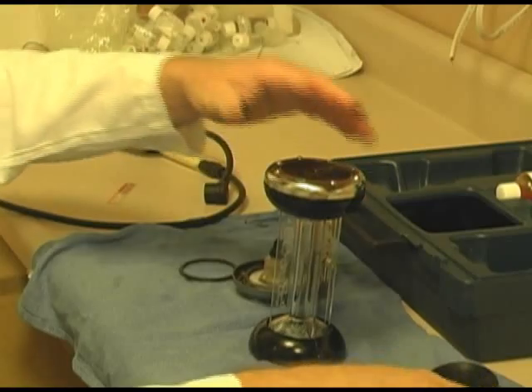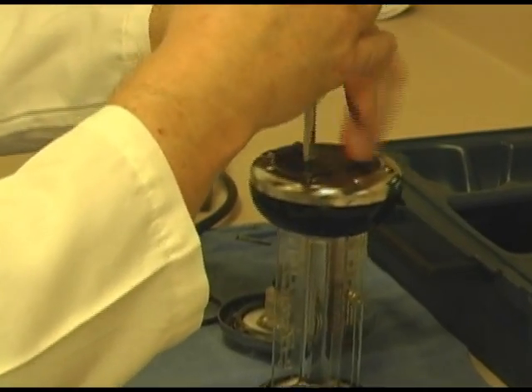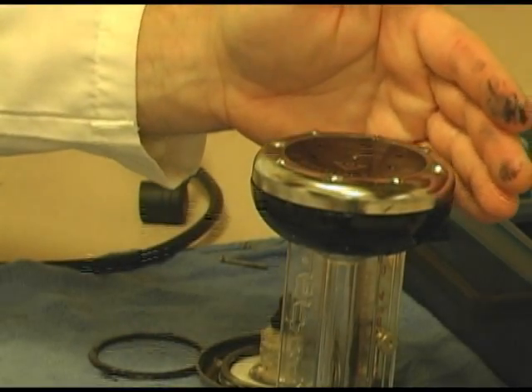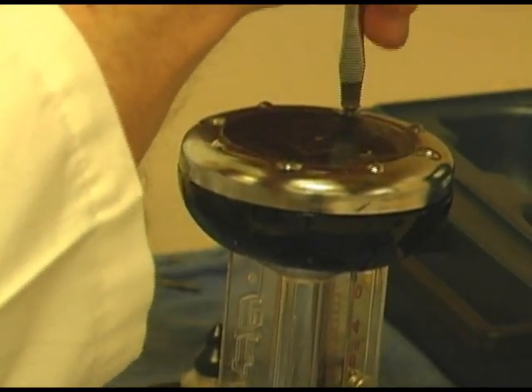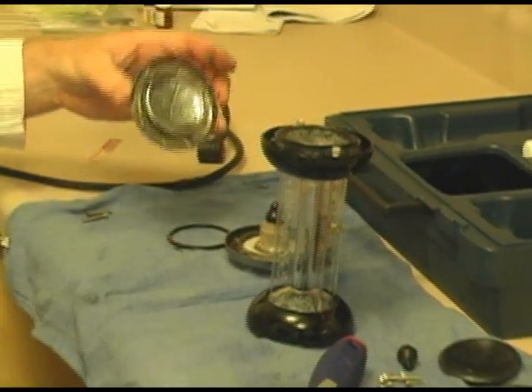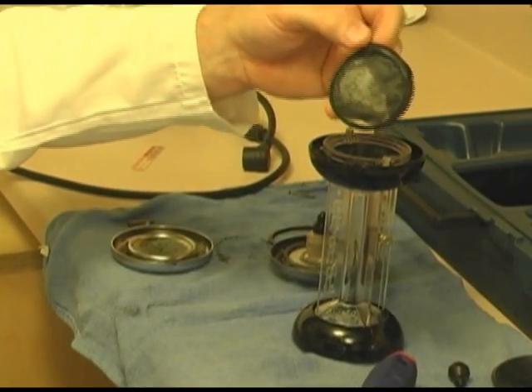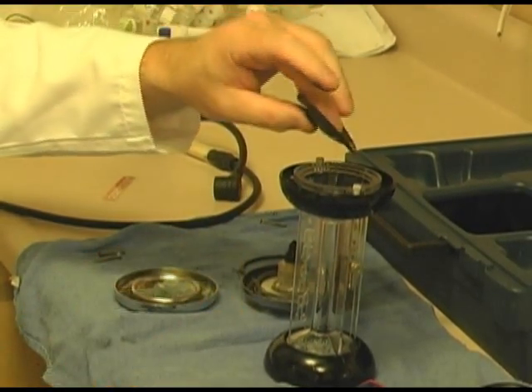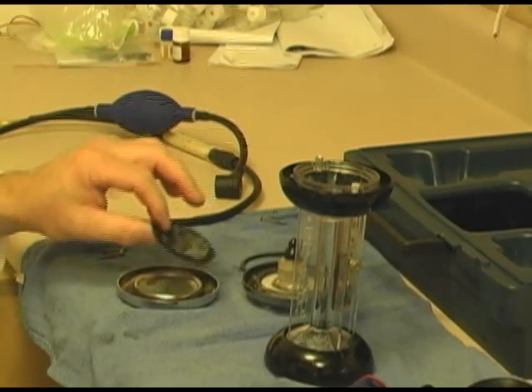Right now we're going to take the bottom off also. Now I personally would do one at a time, but for this video we're going to do both sides. Remove the 4 screws. I don't know if you can see on my hand, but you can see what happens with these rubber gaskets. And underneath here, you will find another rubber membrane gasket. And you can see how it's tore. And of course what happens is then that leaks down into here and causes you all sorts of little problems. And that's all there is to the disassembly of a Fyrite analyzer. Now we're going to rebuild it.